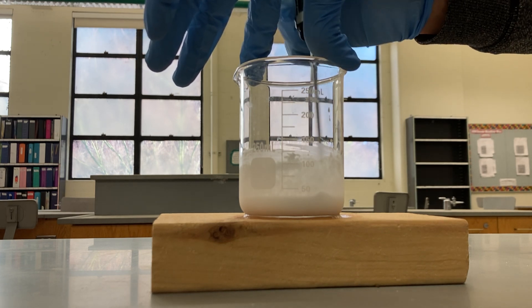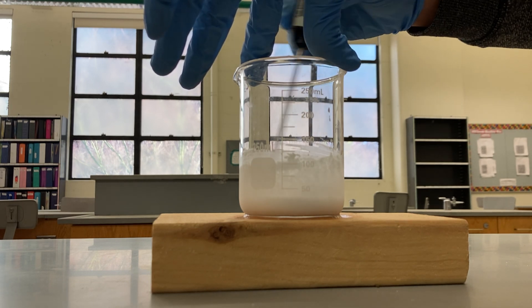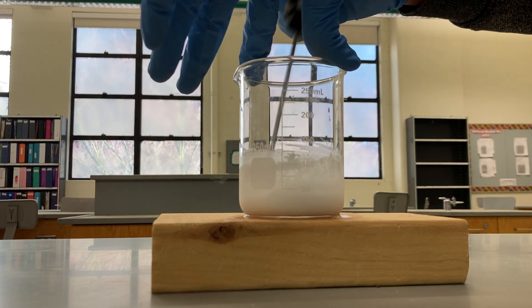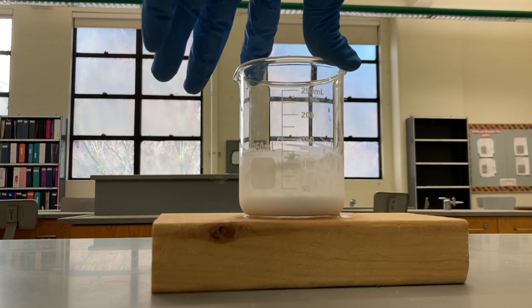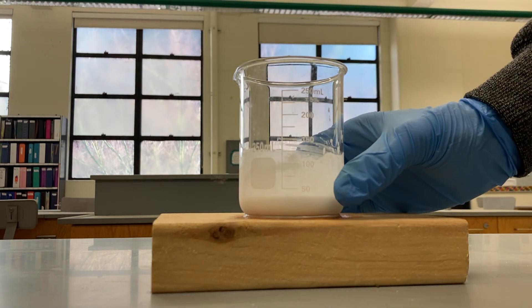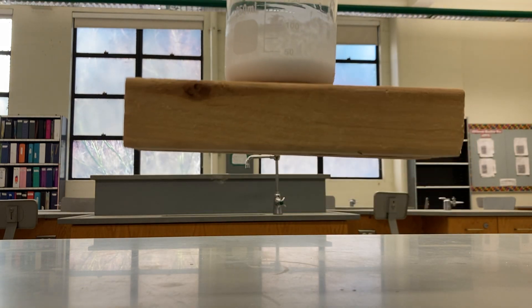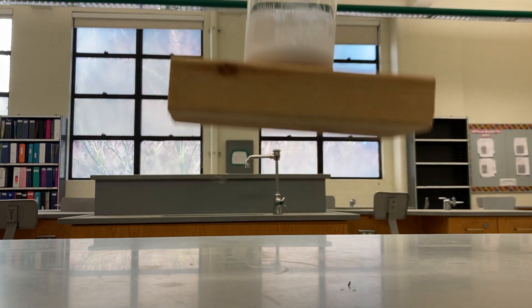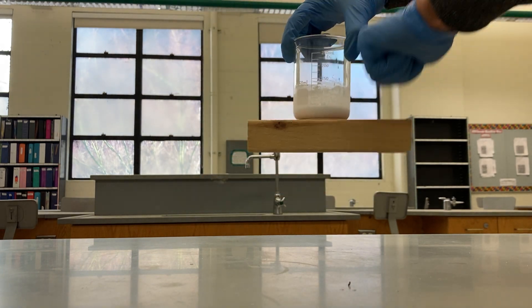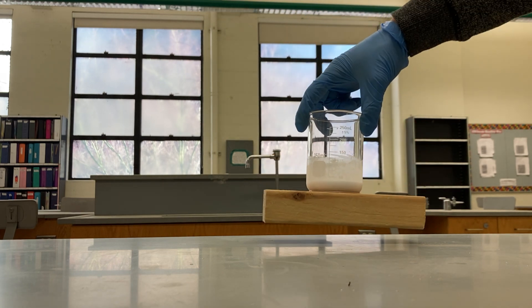There's still a gas being produced that smells strongly. Now I can feel that the beaker is cold down here — but check this out. It's really stuck on there. The board has frozen to the beaker.